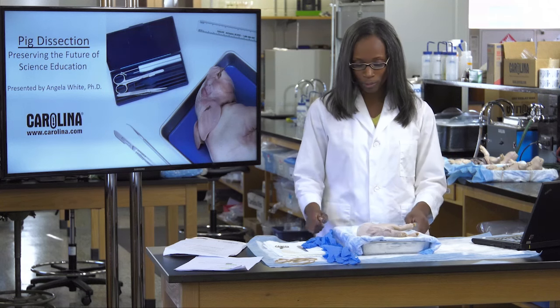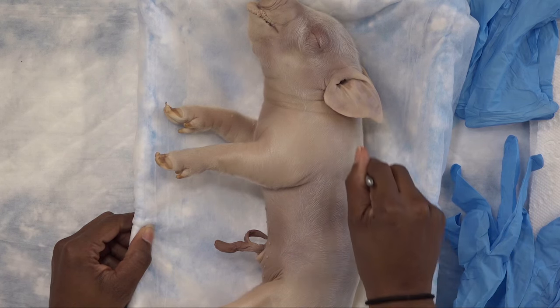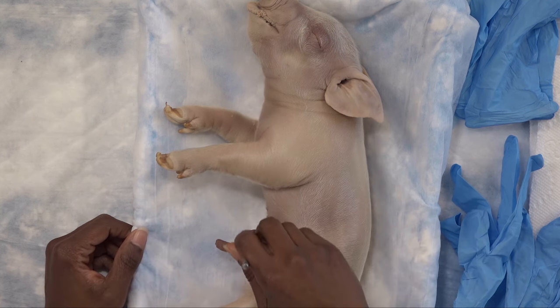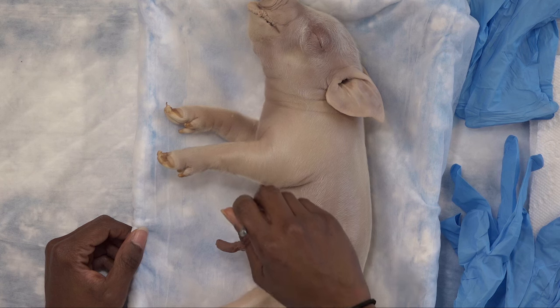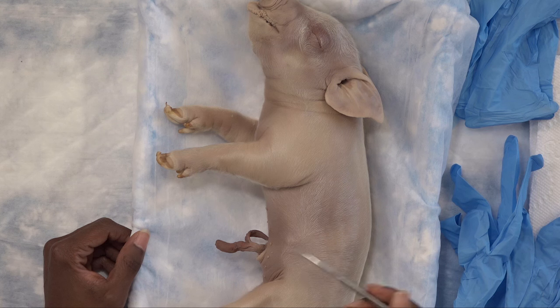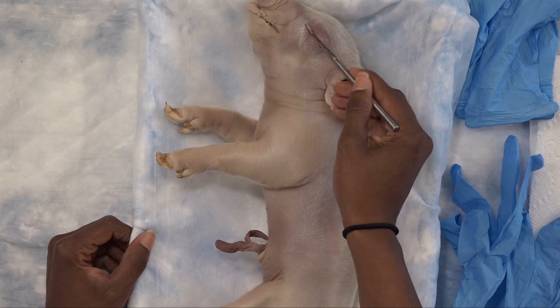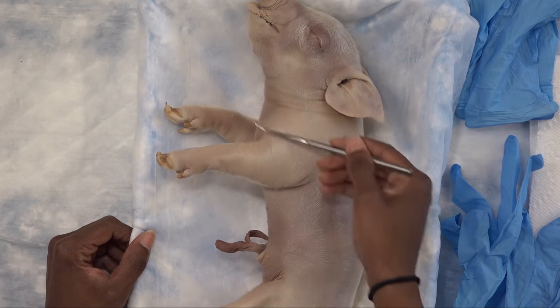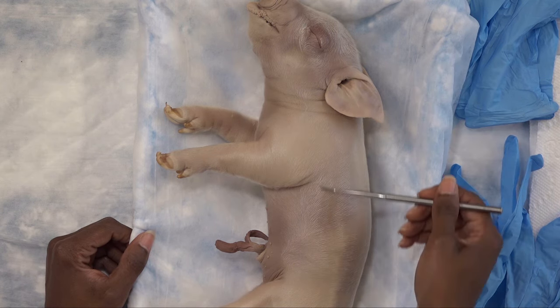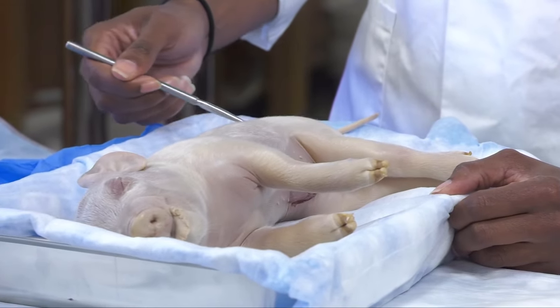Let's take a moment to review. On the backside of your pig we have the dorsal region. As we move to the belly side, that's the ventral region. This region towards the head we will reference as the anterior region. As we start to move towards the tail of your pig, we will reference this as posterior.